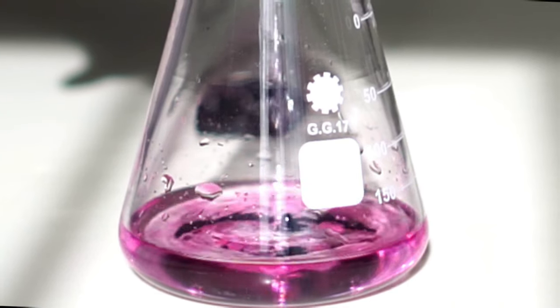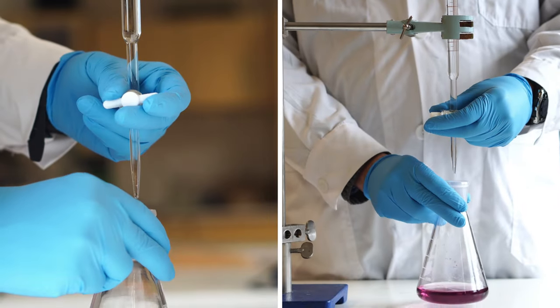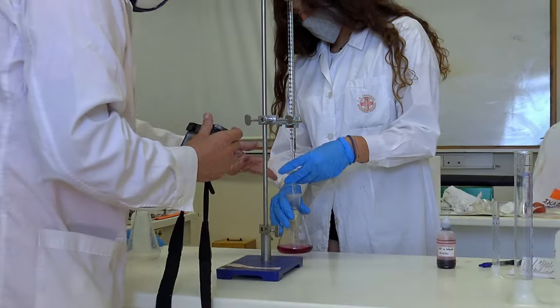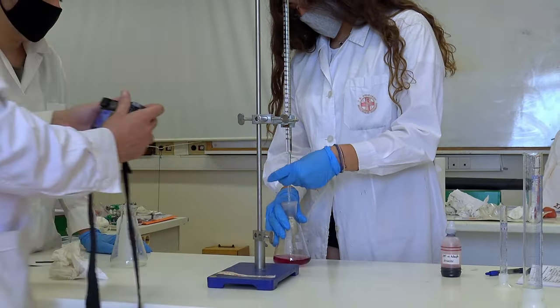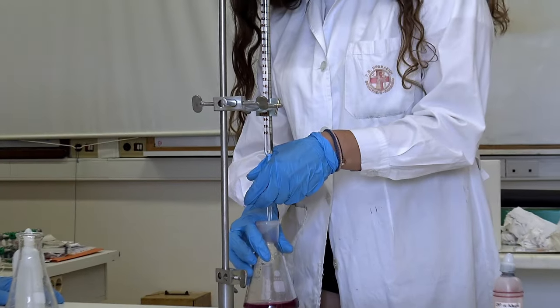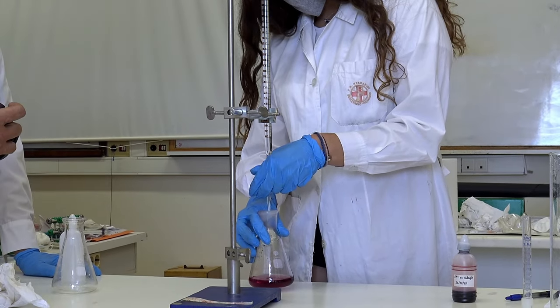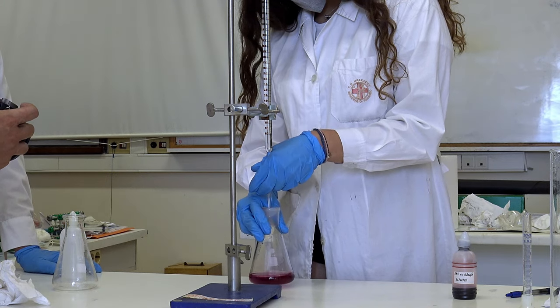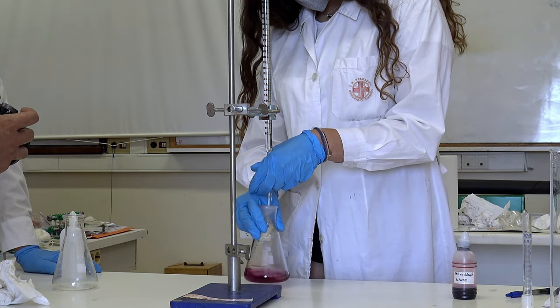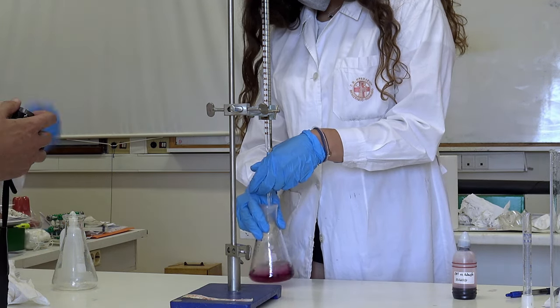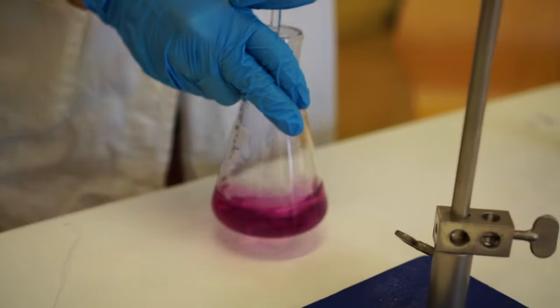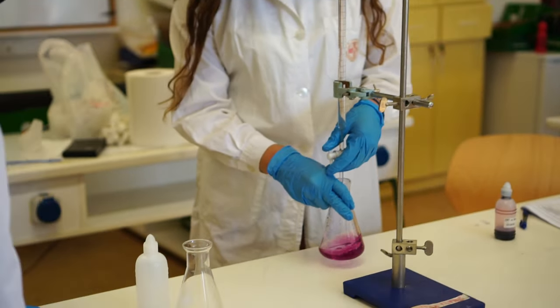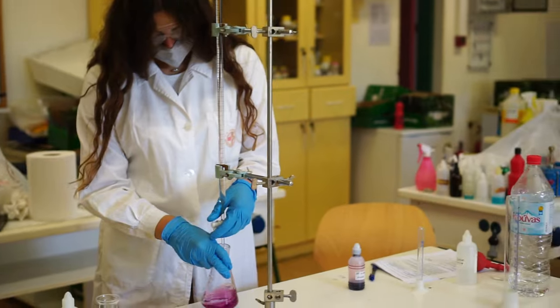After refining the technique, titration begins. It is better to avoid violent stirring, because ammonia is volatile and the pH will decrease. During the first titration, EDTA should flow drop by drop to minimize error at the endpoint.